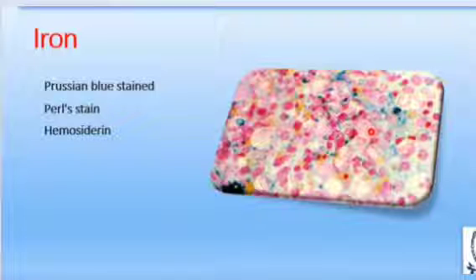Normally, in about 40% of polychromatic erythroblasts, a few small hemosiderin granules are seen scattered in the cytoplasm. Particularly look for ring sideroblasts at the periphery of the fragments, erythroblasts in which hemosiderin granules are larger, more numerous, and arranged in the form of a ring around the nucleus. These are only seen in disease states, that is sideroblastic anemia or myelodysplastic syndrome. So these are the special stains which are used in certain diseases.